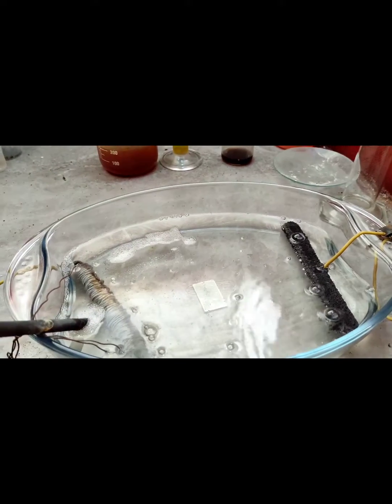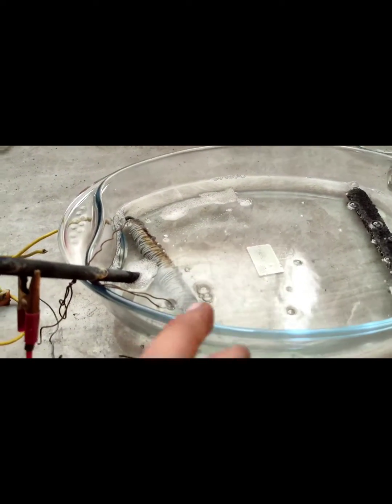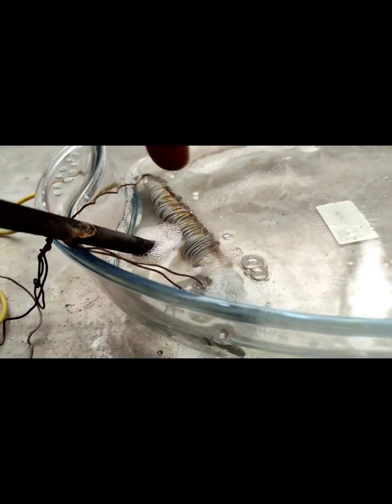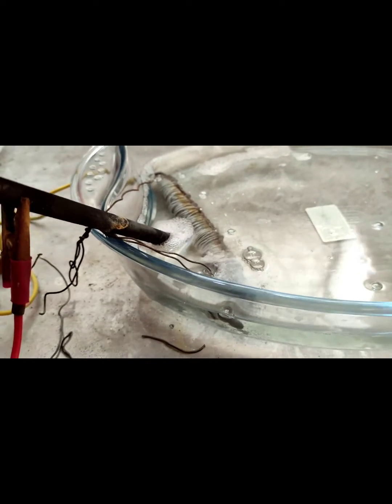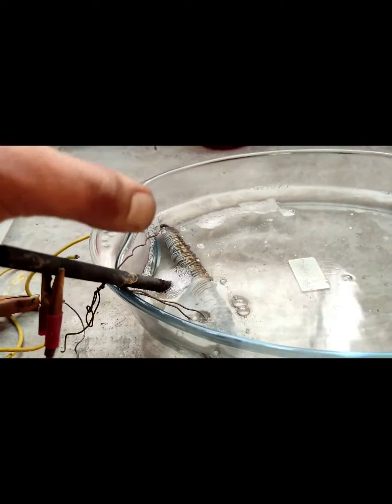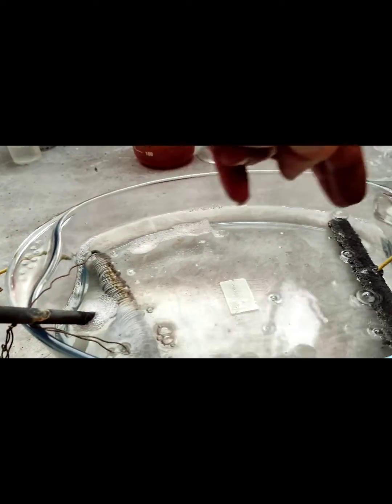This is giving me better results than using sulfuric acid as the electrolyte, since sulfuric acid converts the lead at the anode to lead oxide — lead dioxide — and the lead dioxide covers the metal and prevents further dissolution and transfer.